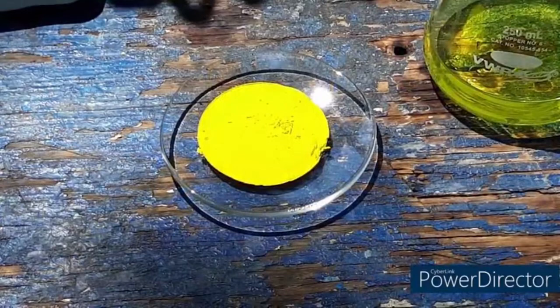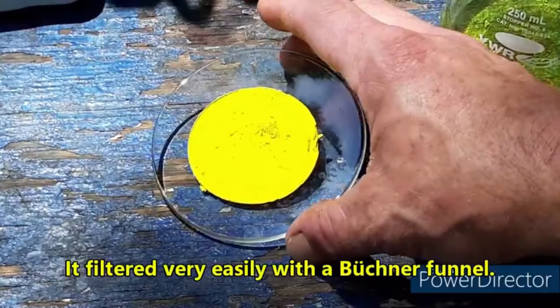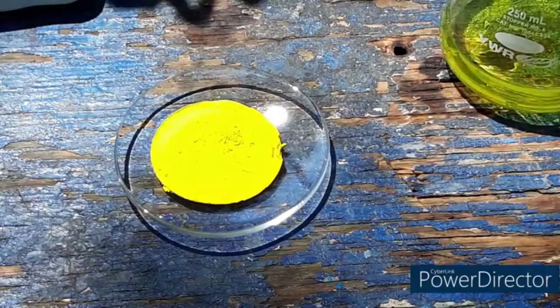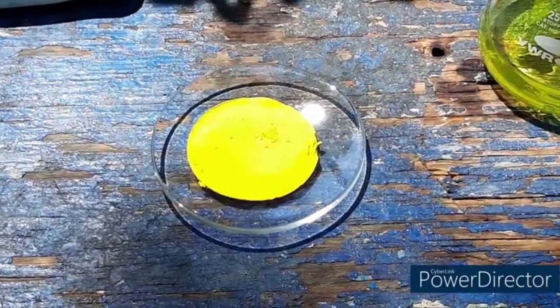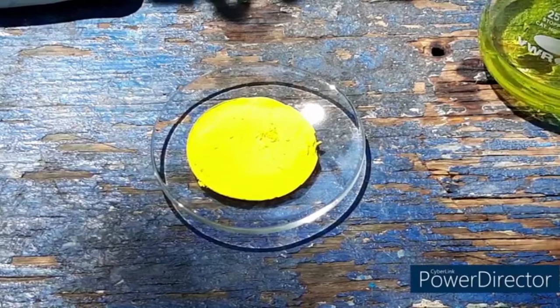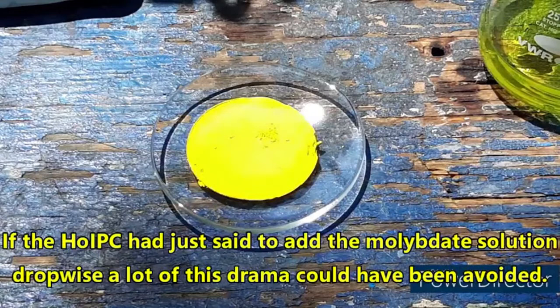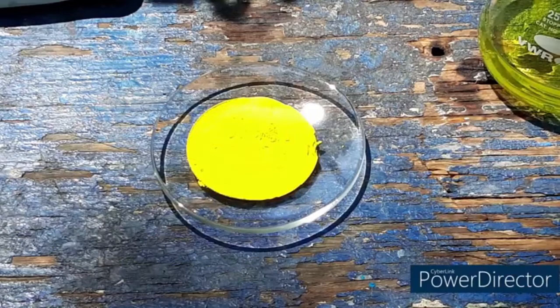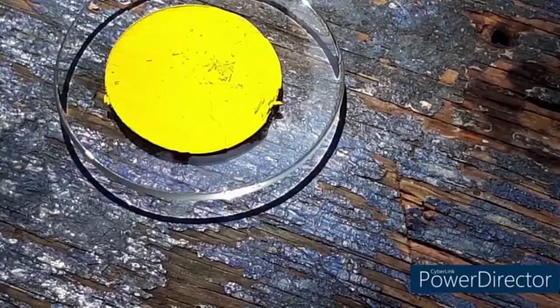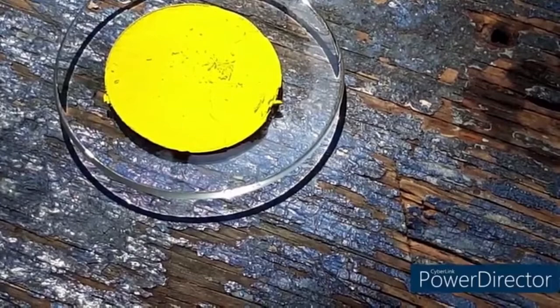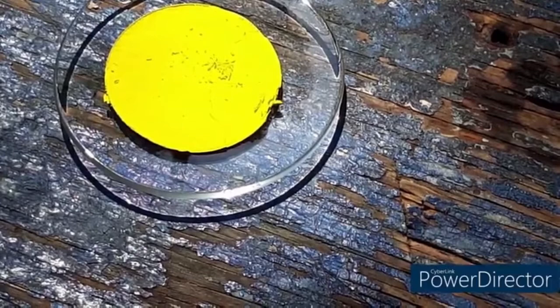There we have it. I have filtered off the potassium salt. You can see it is a beautiful, vivid, brilliant yellow. That is so fucking gorgeous man. I am so fucking happy this shit worked. I have worked so hard on this motherfucker for days now. I am so fucking pleased that I got this. I think I'm going to have to give this one and a half chemgasm. We got the potassium salt of our polyoxometalate. Look at it in its yellow glory. Yellow chem good!